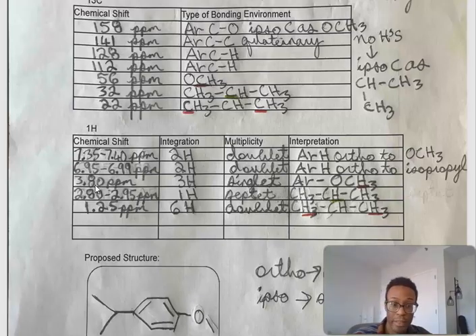We have 2.8 to 2.95 ppm, which has an integration of 1H, a multiplicity as a septet, though a bit unclear, which is representative of the hydrogen between the methyls of the isopropyl group. In addition, we have 1.25 ppm with an integration of 6H, a doublet, suggesting one other neighbor. These are representative of the 2 methyl groups of the isopropyl.